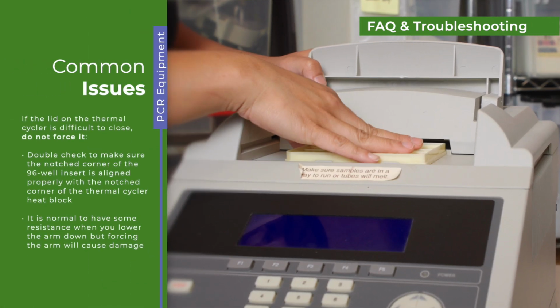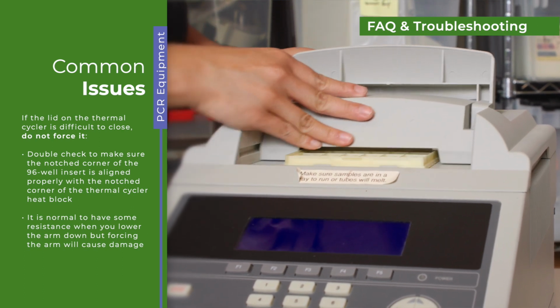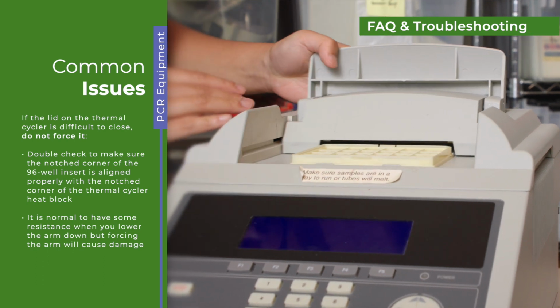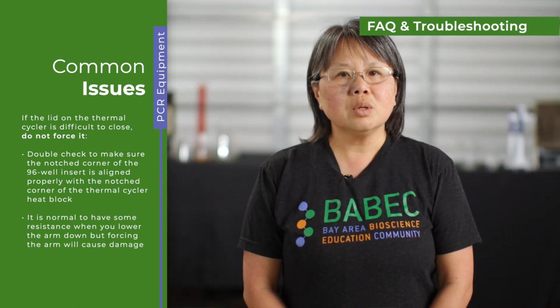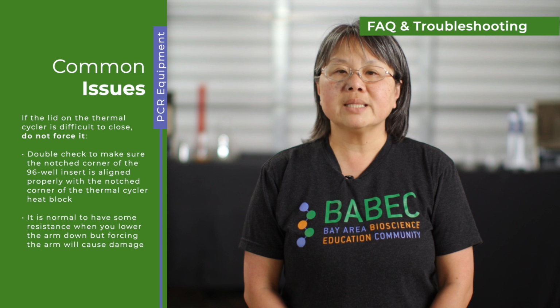If the lid on the thermocycler is difficult to close, do not force it. Double check to make sure the notched corner of the 96 well insert is aligned properly with the notched corner of the thermocycler heat block. It is normal to have some resistance when you lower the arm down, but forcing the arm will cause damage.